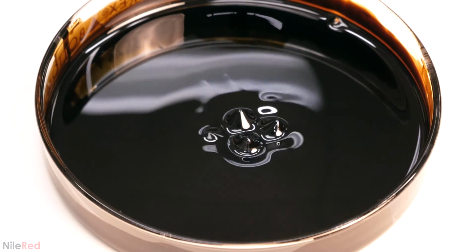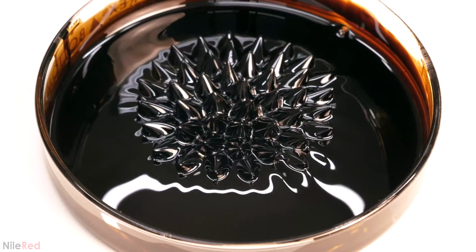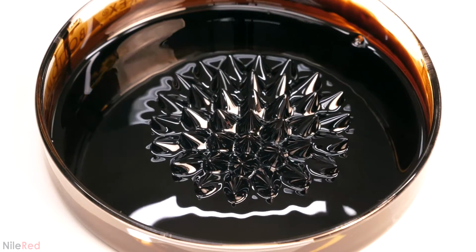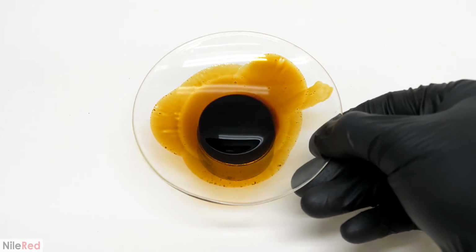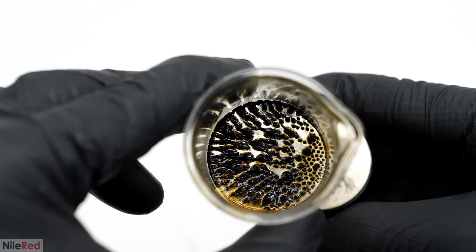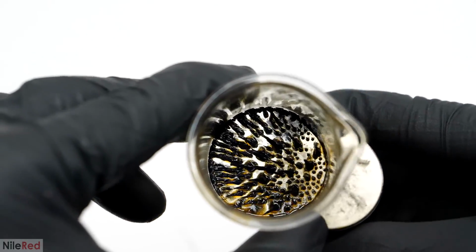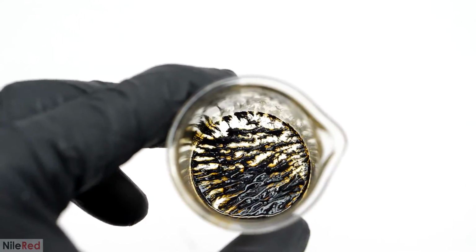When a ferrofluid goes near a magnet, or just a magnetic field in general, it should easily form these weird looking spikes, and it should also still look like a fluid. What I made, though, either just didn't do much of anything, or it partially solidified and formed these semi-solid spikes. I actually thought that this was still kind of cool, but it was far from being a proper ferrofluid.